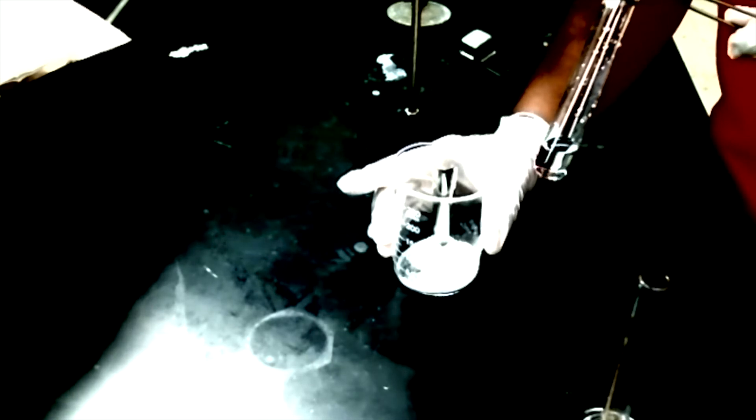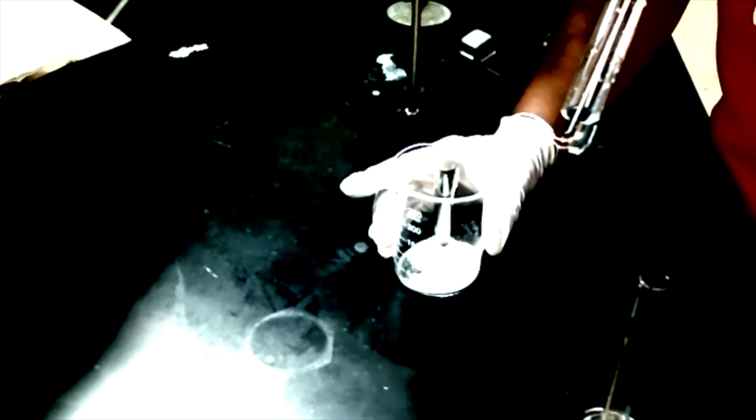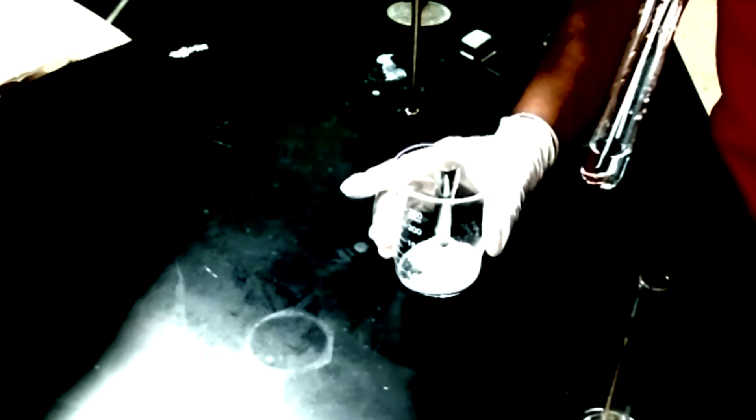So as previously mentioned, we added small aliquots of the sodium thiosulfate into our solution until only a small amount of crystal remains at the bottom of our test tube. So we then measured the remaining sodium thiosulfate plus the beaker and came out with a weight of 110.36 grams, which means that 12.89 grams of sodium thiosulfate was not dissolved into our test tube. Therefore, 2.17 grams of sodium thiosulfate was dissolved into our test tube.